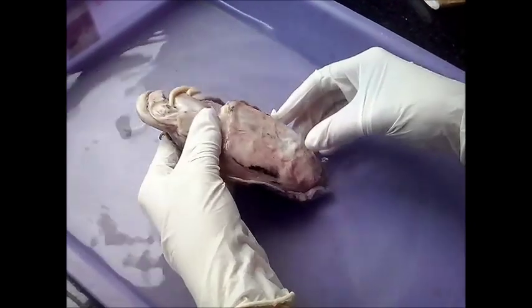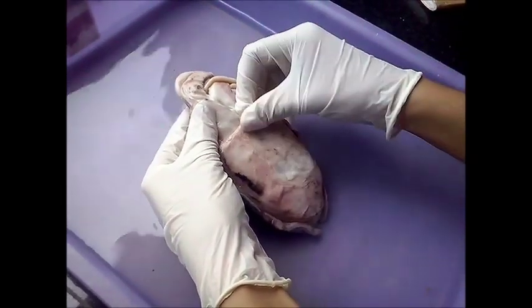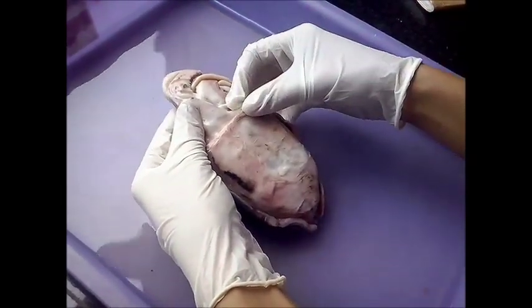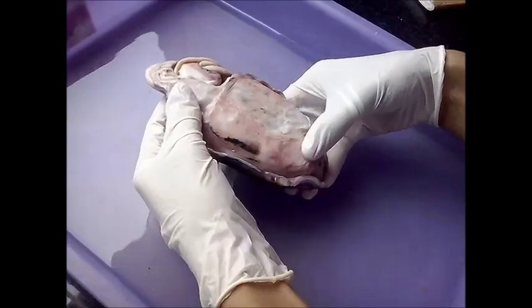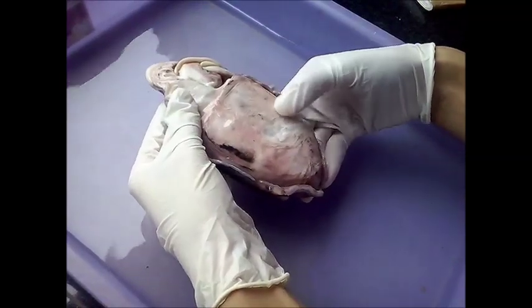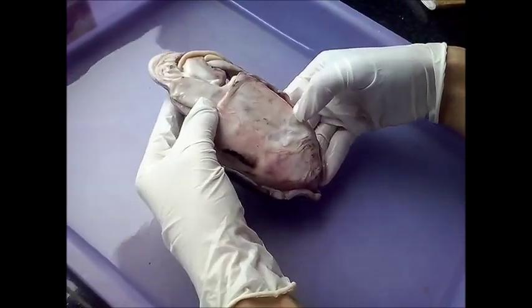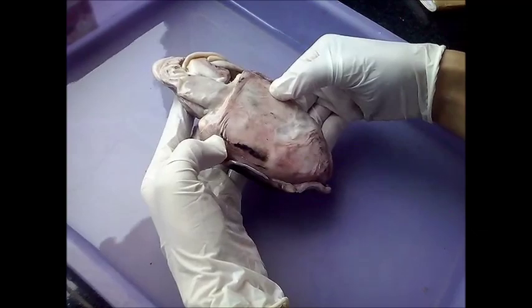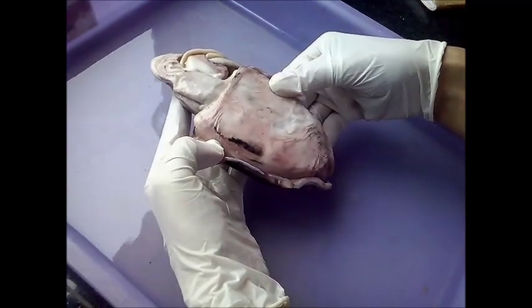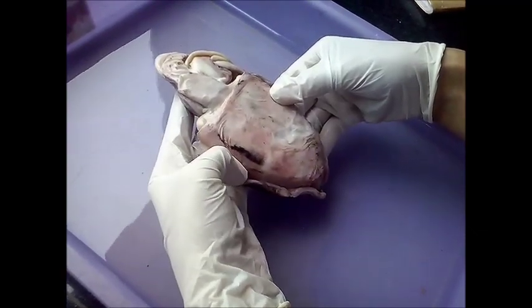On the ventral side you will see that the colouration is much less dark compared to the dorsal side, because the chromatophores are fewer and there is a presence of iridophores.